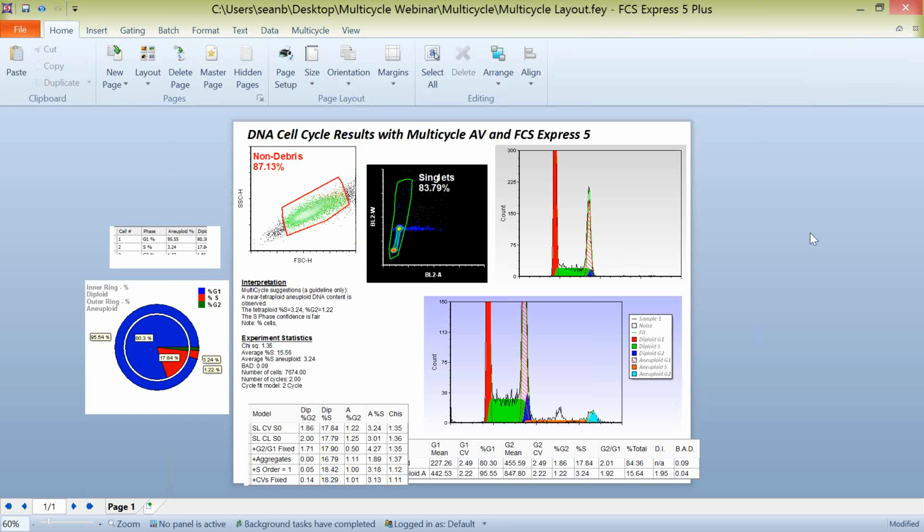Another way that you can work with this data in FCS Express 5 is to set up pie charts in the software. I encourage you to take a look at our website and our other recorded webinars about how to create these pie charts. But the great thing about this, again, is as I move a gate, our model will be recalculated on the fly. It will adjust wherever we have that data displayed, whether it be in some set of pie chart or within an analysis template itself.